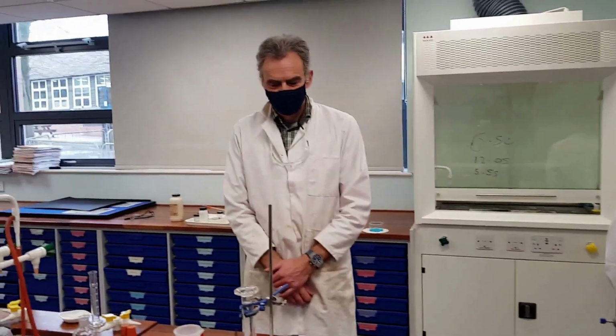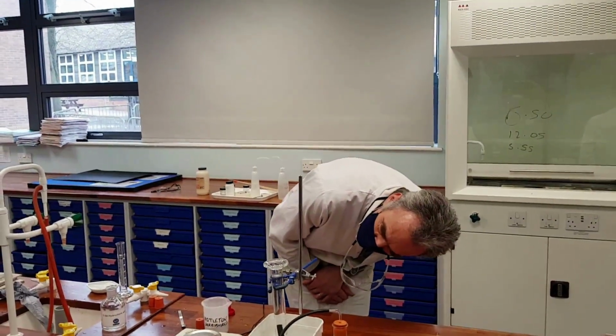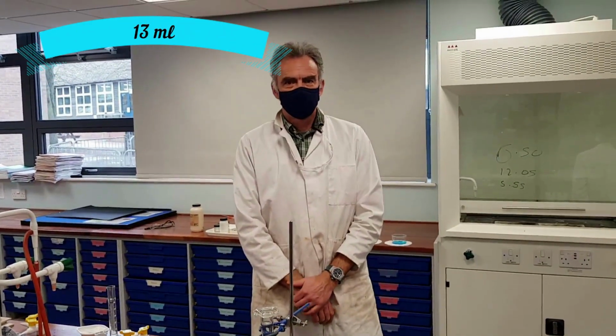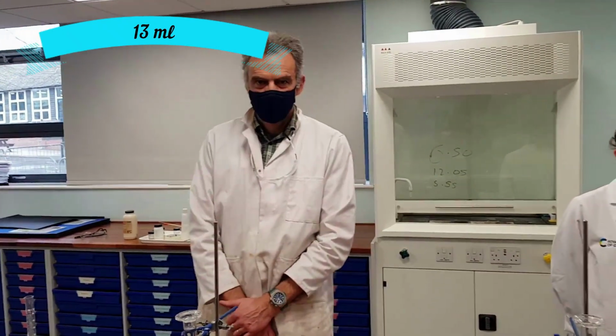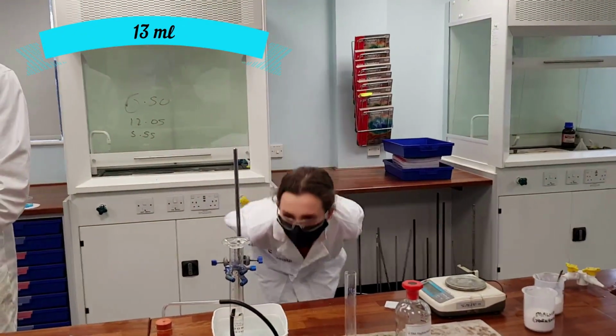And how many millilitres did you get this time, Mr. Reeves? I got 13. 13 millilitres, which isn't bad, given that Miss Richardson got 16 millilitres. So actually, quite a reproducible experiment there. Miss Richardson, how many millilitres did you get?